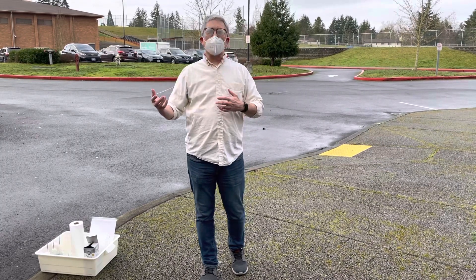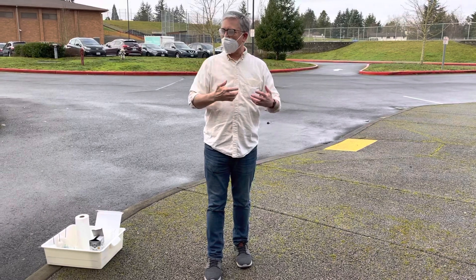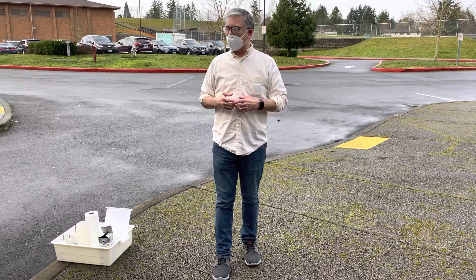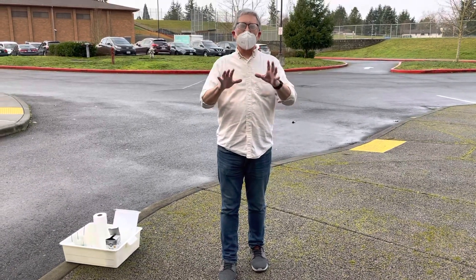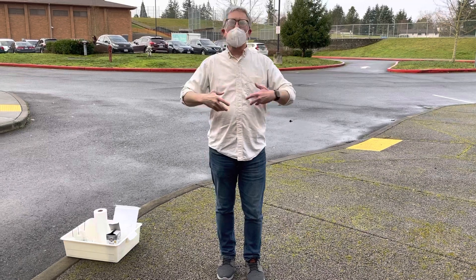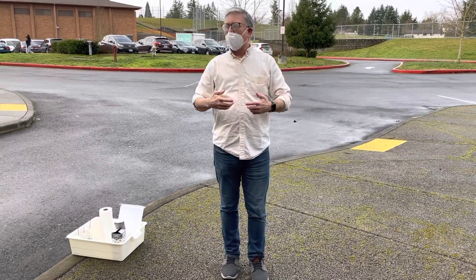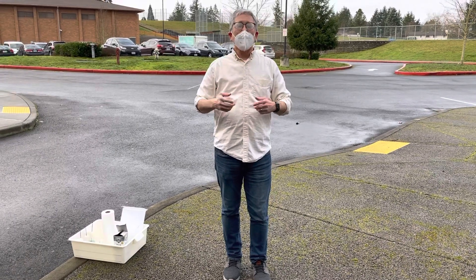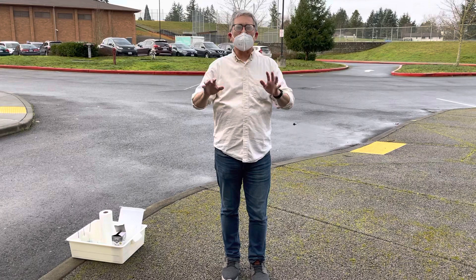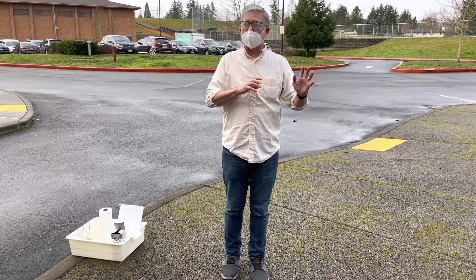We're going to get the results that you would normally get. You're going to collect data on the results we get, which is as close as we can come to doing the lab yourself, and then we'll take a look at the data. The purpose of this lab is to see how the amount of carbon dioxide produced by our body in our breaths going out is influenced by exercise. You probably already have an idea of what's going to happen, but we're going to prove if your prediction is right or not.